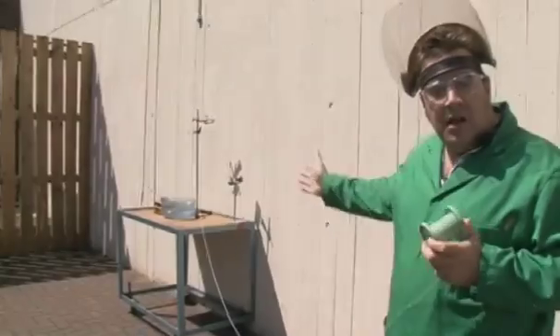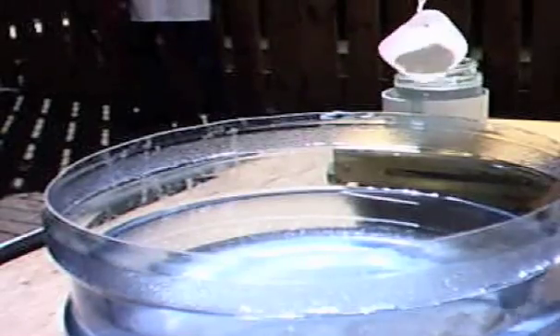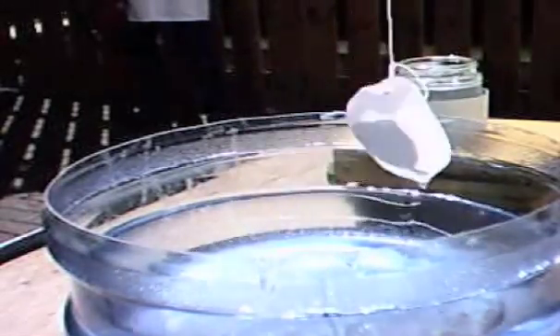So we have our caesium under oil. We now need to lift it up using the new device and then drop it in the water, and let's see what sort of chemical reaction it does today.